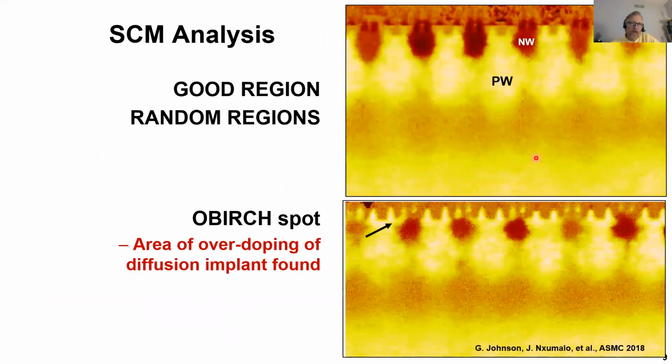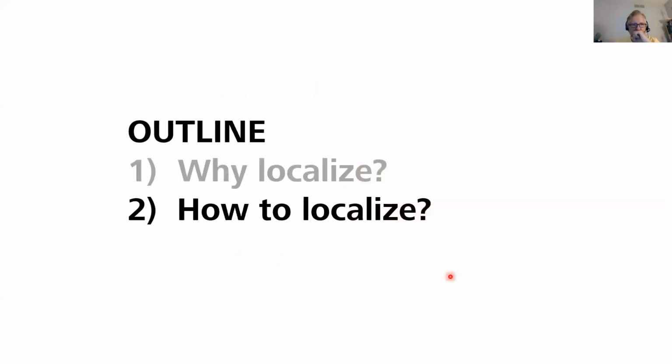And here are the results. The image here on the right shows both a good region and also what you're likely to get if you just cut a random region. We have a nice regular array of wells, nicely formed. However, at one of our OBIRCH spots, we can see very carefully here, you can see the yellow being the P well or the P-type material. We have an area of over-doping of the diffusion implant. Thus, we learned that defect localization was able to find the exact spot of the leakage.